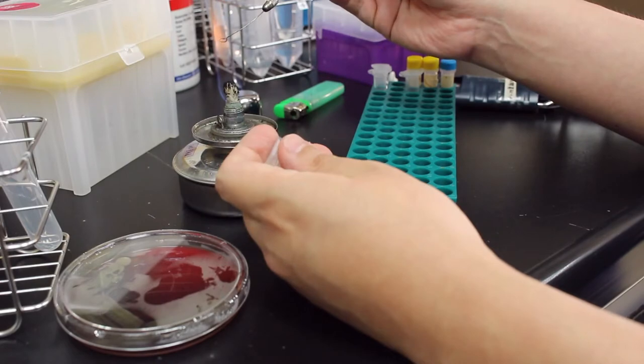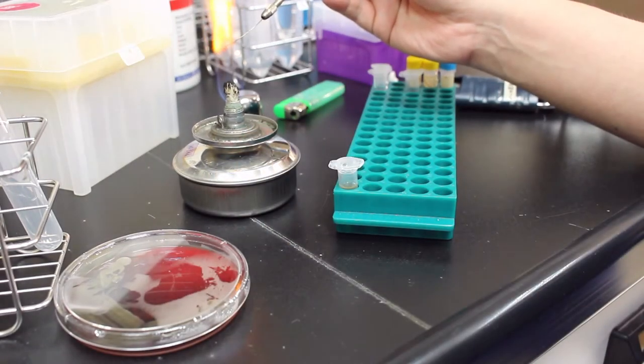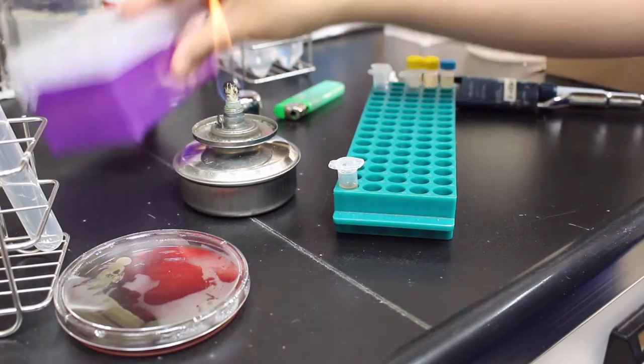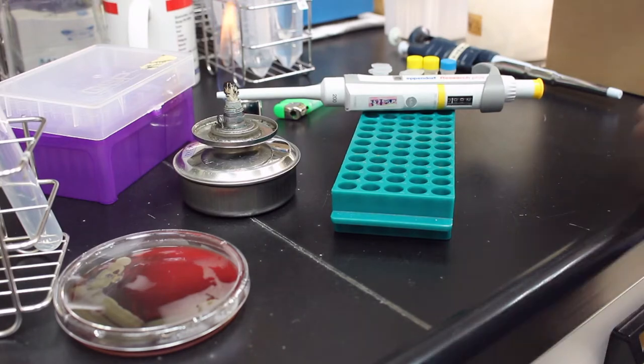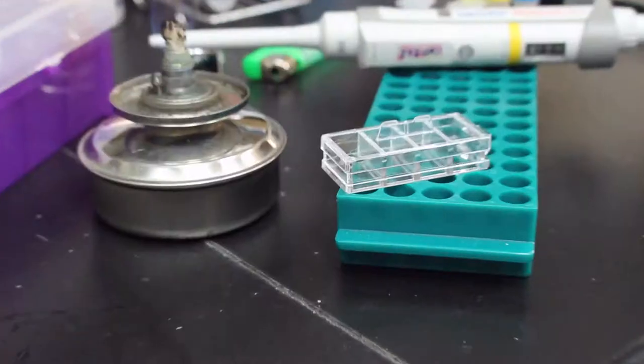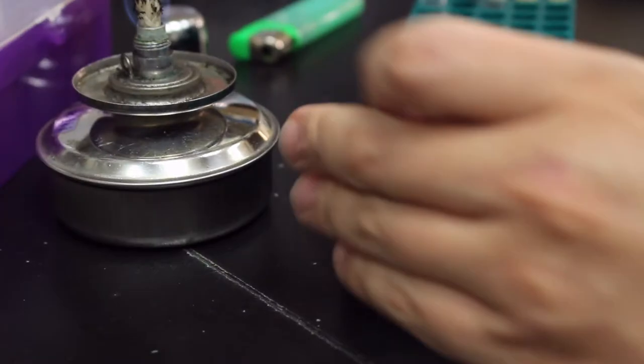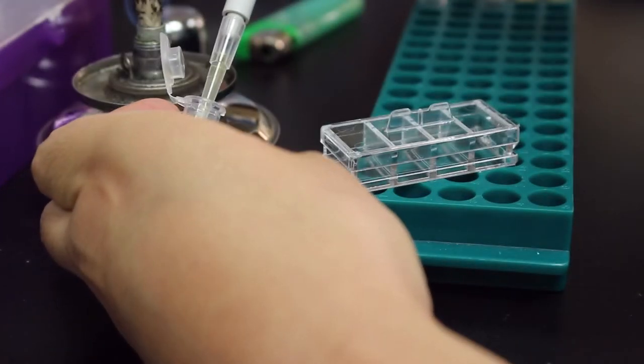Here I put some growth medium with bacteria I isolated from the skin. I had one failed attempt before where the bacteria just stopped growing, and I suspect it's because I was using a normal cover slide that doesn't provide enough oxygen for the bacteria.